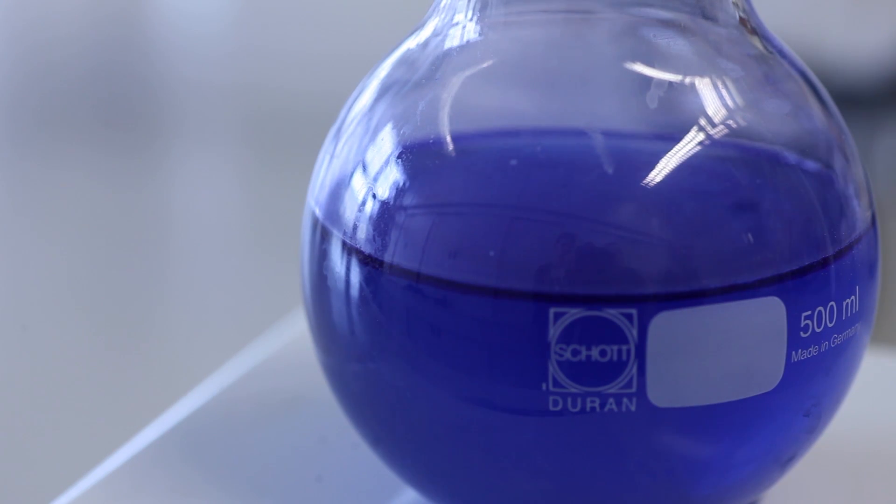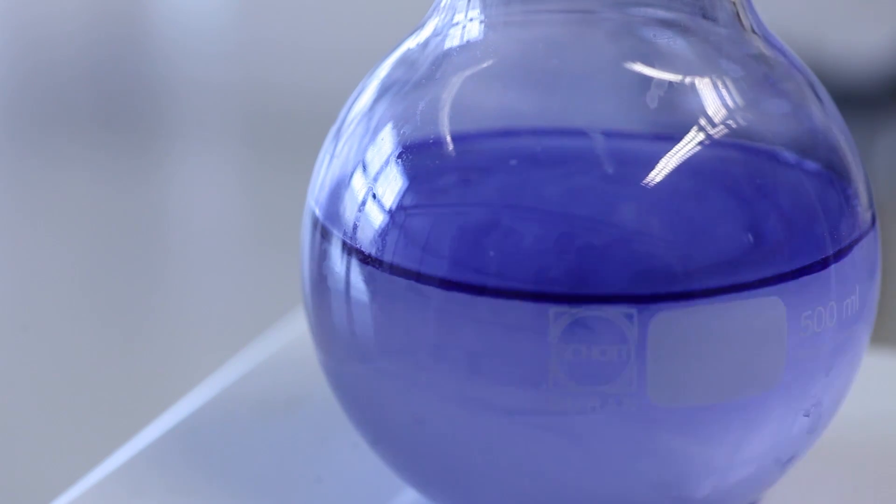When the solution is allowed to rest, the glucose reduction of the dye gains the upper hand and the color disappears again.